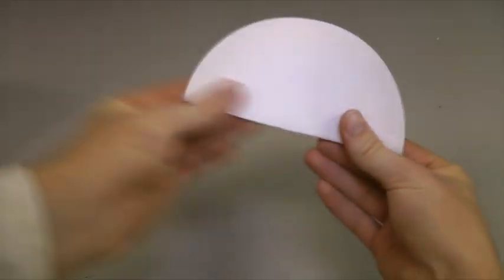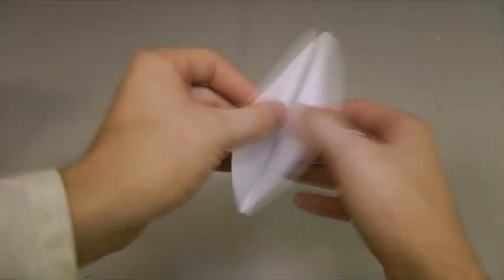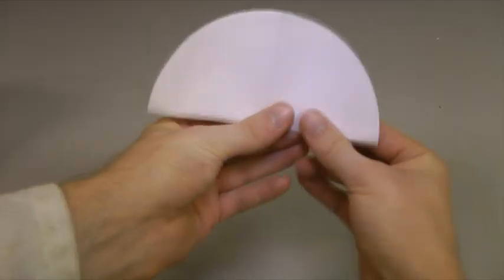To make your own fluted filter paper, you first fold the filter paper in half, then into quarters, the two folds being in the same direction.